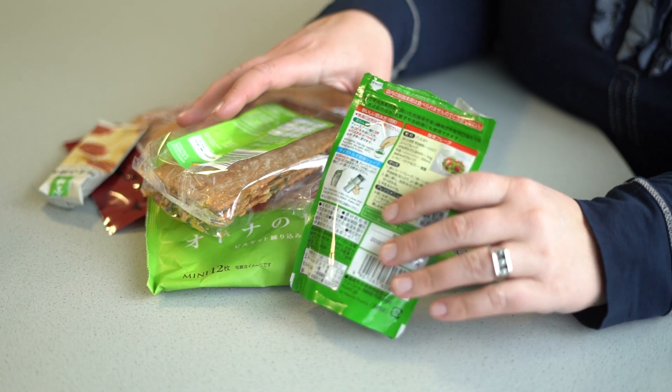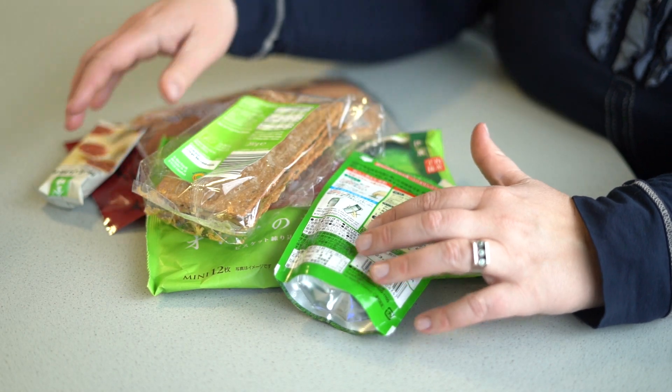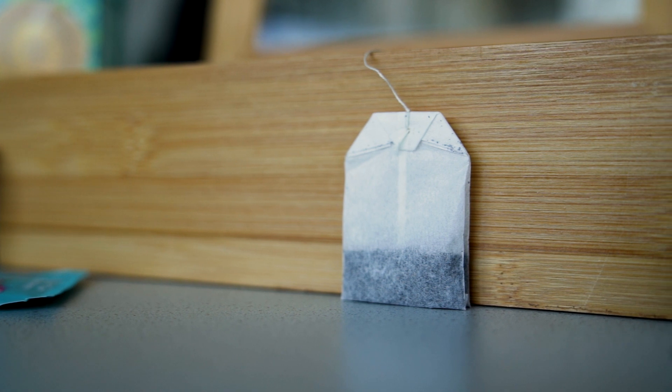The production of food packaging is subject to strict regulations, like almost everything that comes into contact with food. Tea bags are no exception to this rule.